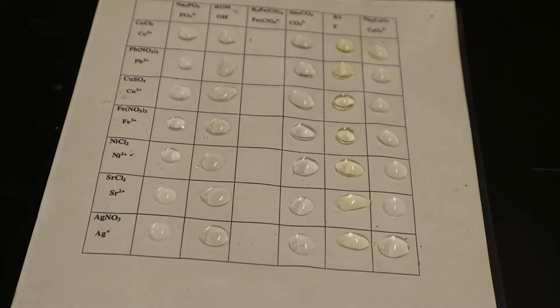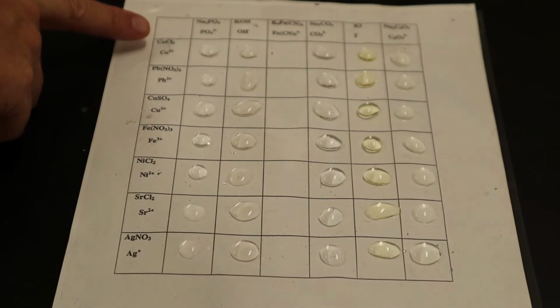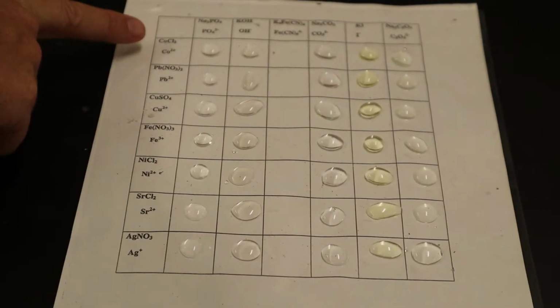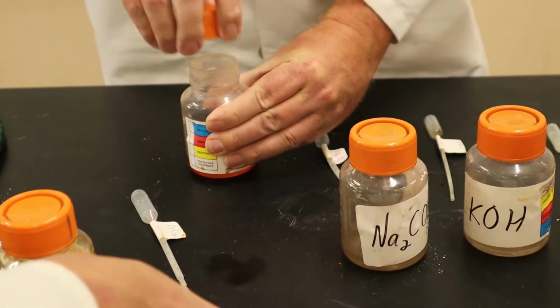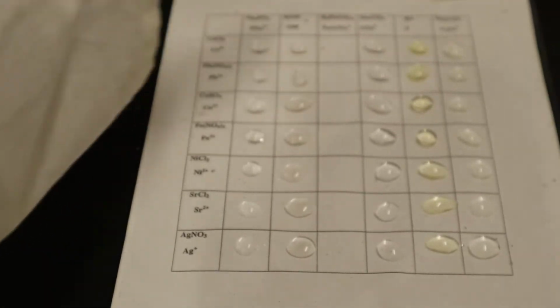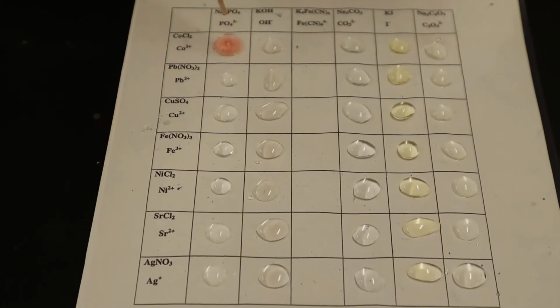All right, so now he's going to start going across. He's going to add cobalt chloride. Cobalt, right? I'm sorry, cobalt, my bad. You are correct. This is the red one right here. Thank you, sir. And as he drops the cobalt chloride, the double replacement reactions will go, and you'll see how many precipitates you get. Ooh, looks like you got one there.